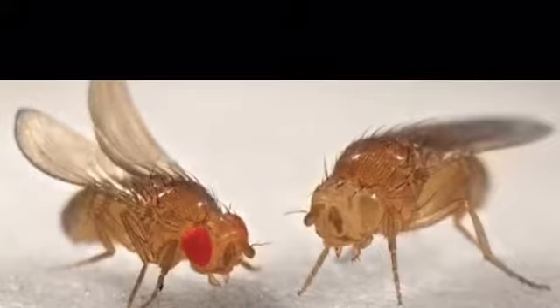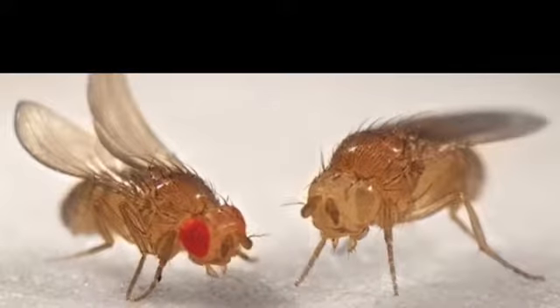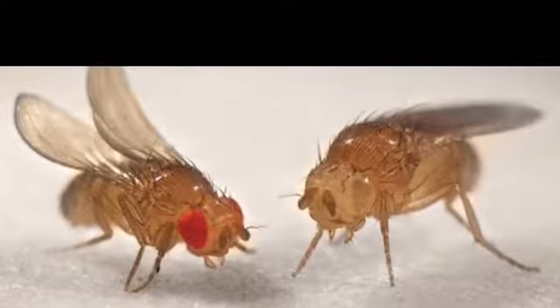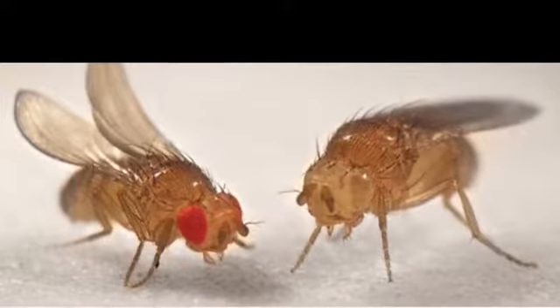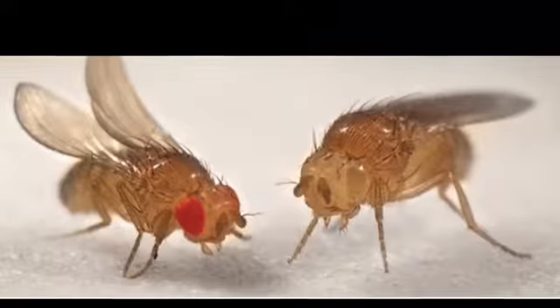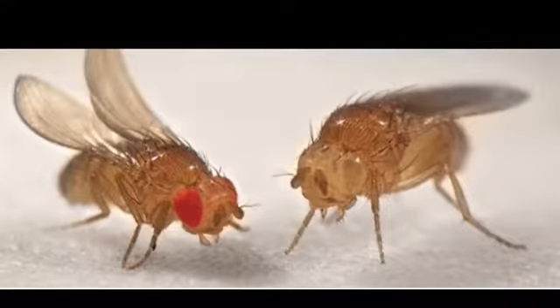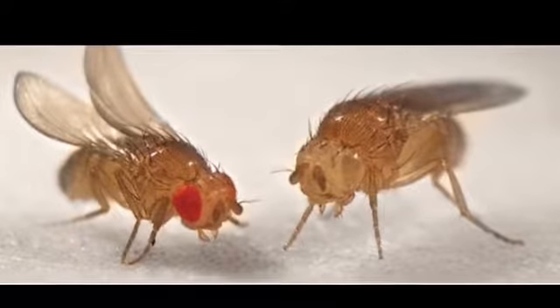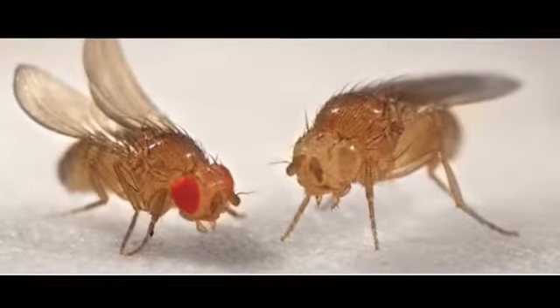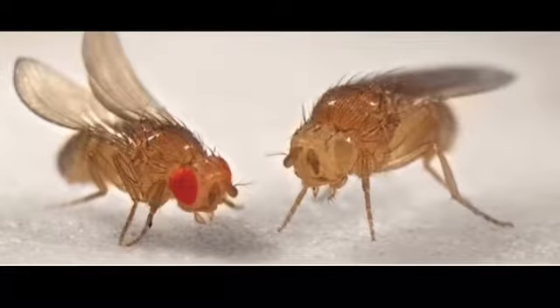A wild-type fruit fly consists of a tan body with red eyes. In this experiment, the mutant fruit fly that was used consisted of a tan body with white eyes. The trait for red eyes is a dominant trait. A dominant trait is a trait that will show regardless of whether or not the organism carries one or two alleles for that trait. The trait for white eyes is an X-linked trait. An X-linked trait is a trait that is carried by the sex-determining chromosome X.